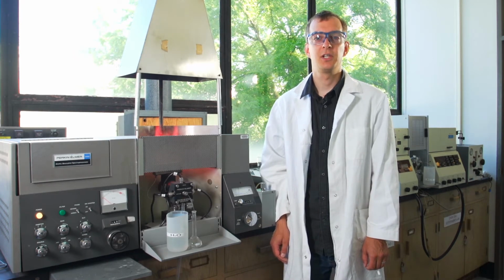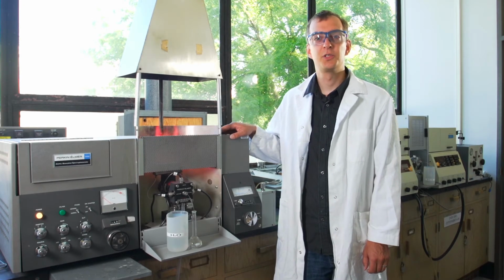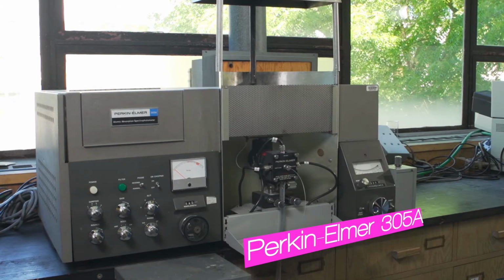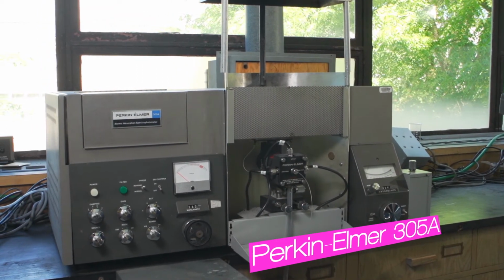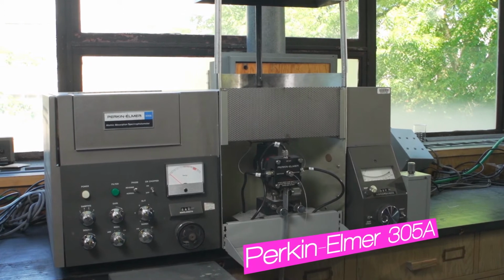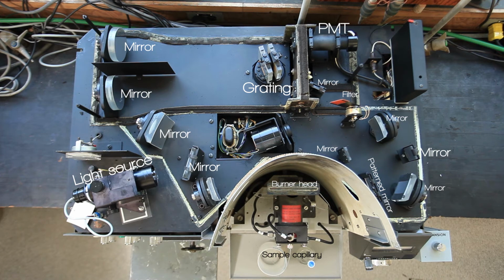I'm Dr. Robin Studley, and this video will be about the instrumental setup for atomic absorption spectrophotometry. The instrument we're looking at is the PerkinElmer 305A Atomic Absorption Spectrophotometer. What we see today will be very typical of a double beam atomic absorption system.